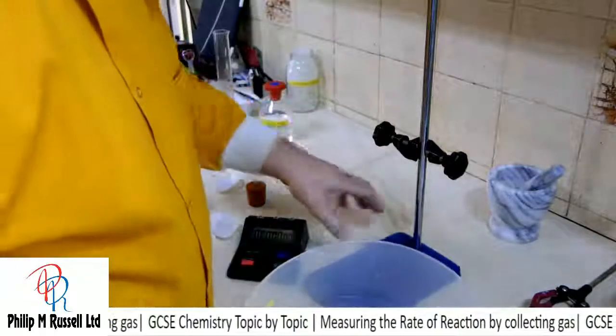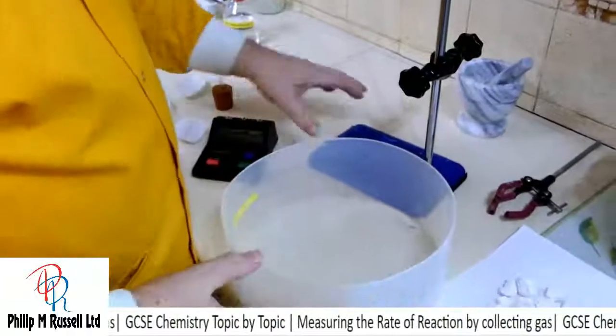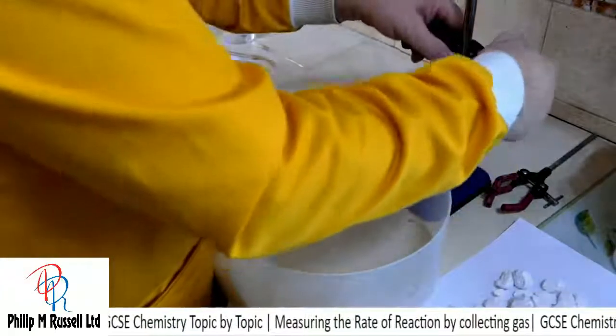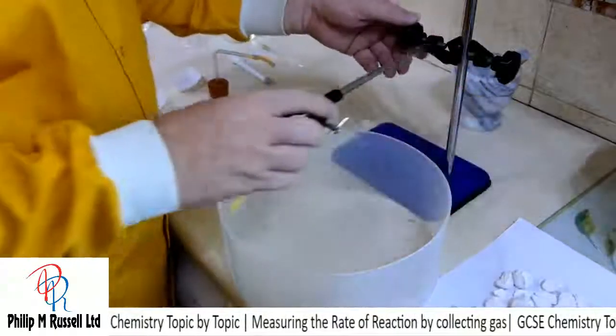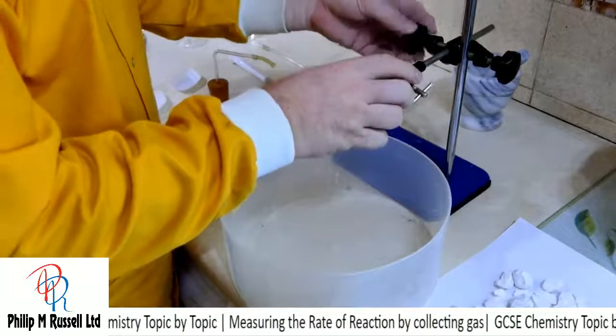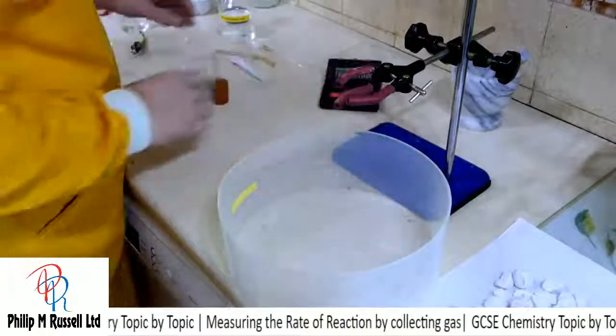And what I've got here is a trough which we're going to fill with water, and then I knew I was going to forget something. We're going to collect the gas. Now I can do it like this, but I'm going to find it easier not to.